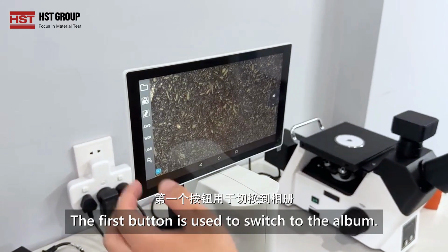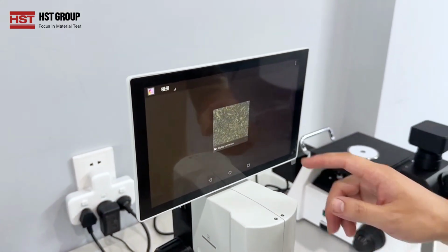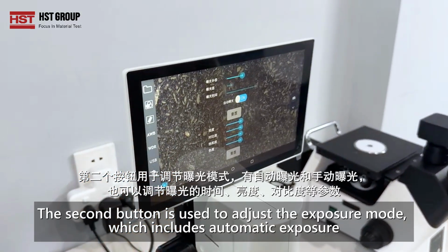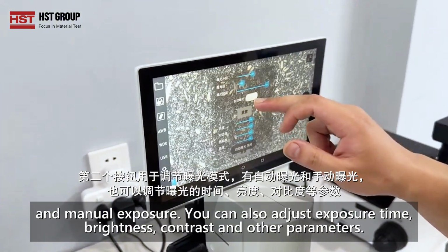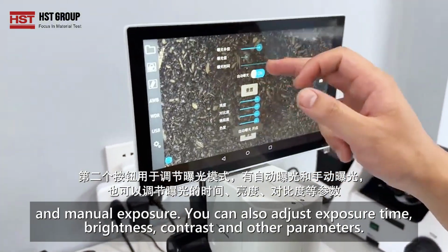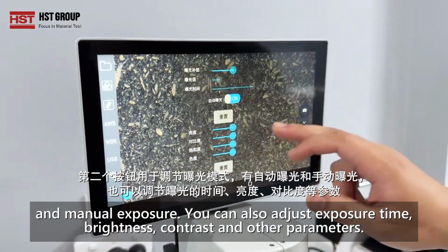The first button is used to switch to the album. The second button is used to adjust the exposure mode, which includes automatic exposure and manual exposure. You can also adjust exposure time, brightness, contrast, and other parameters.